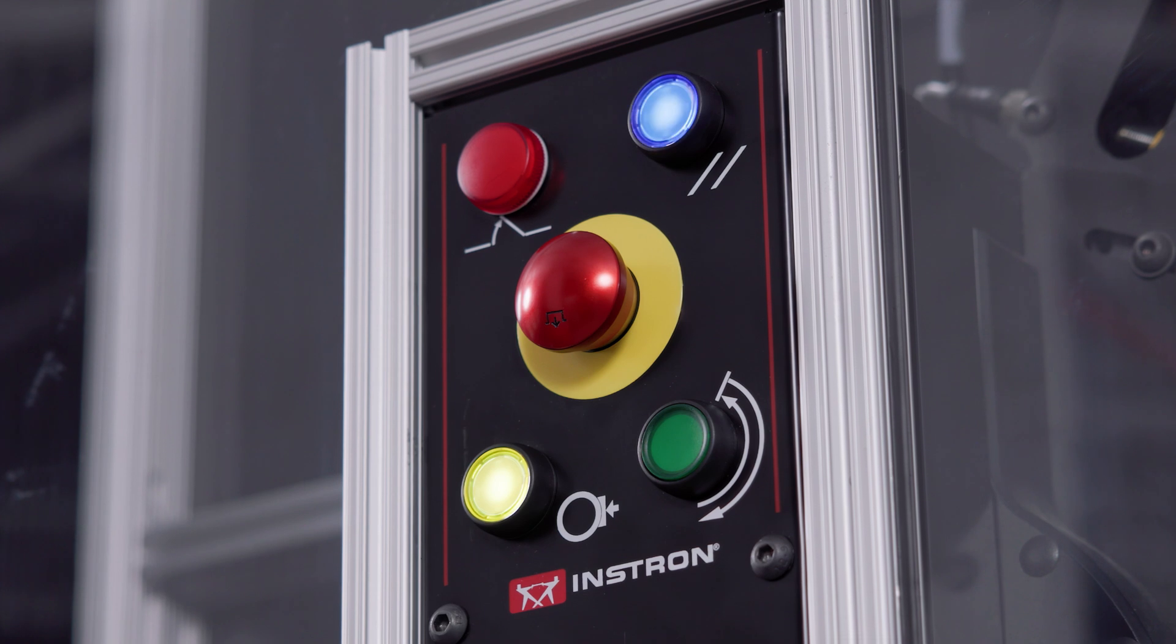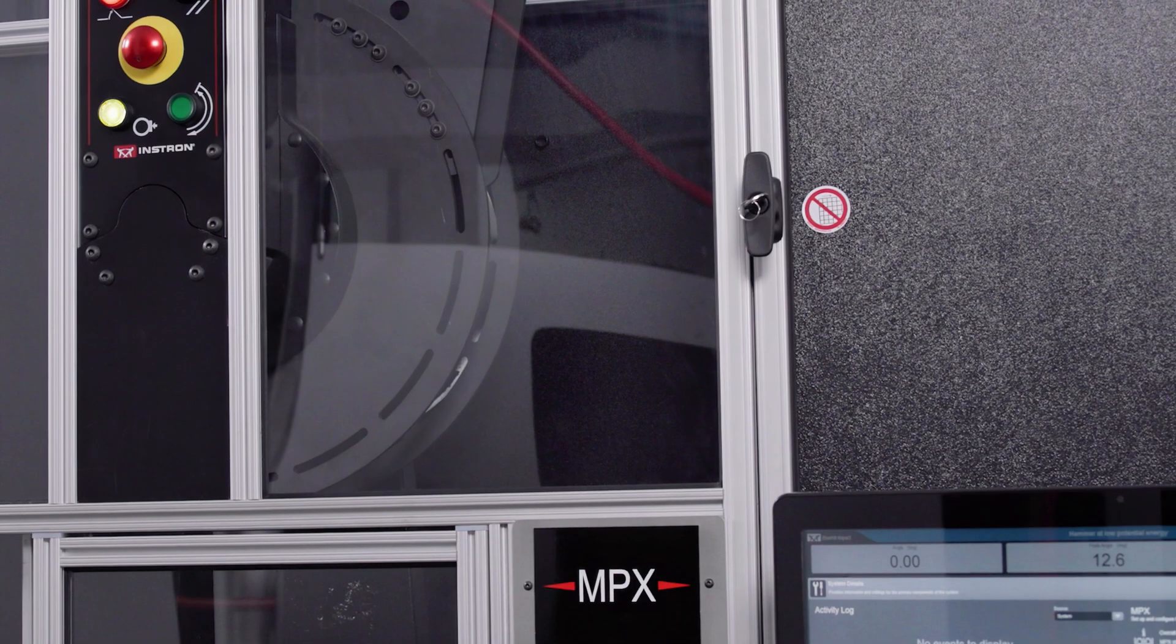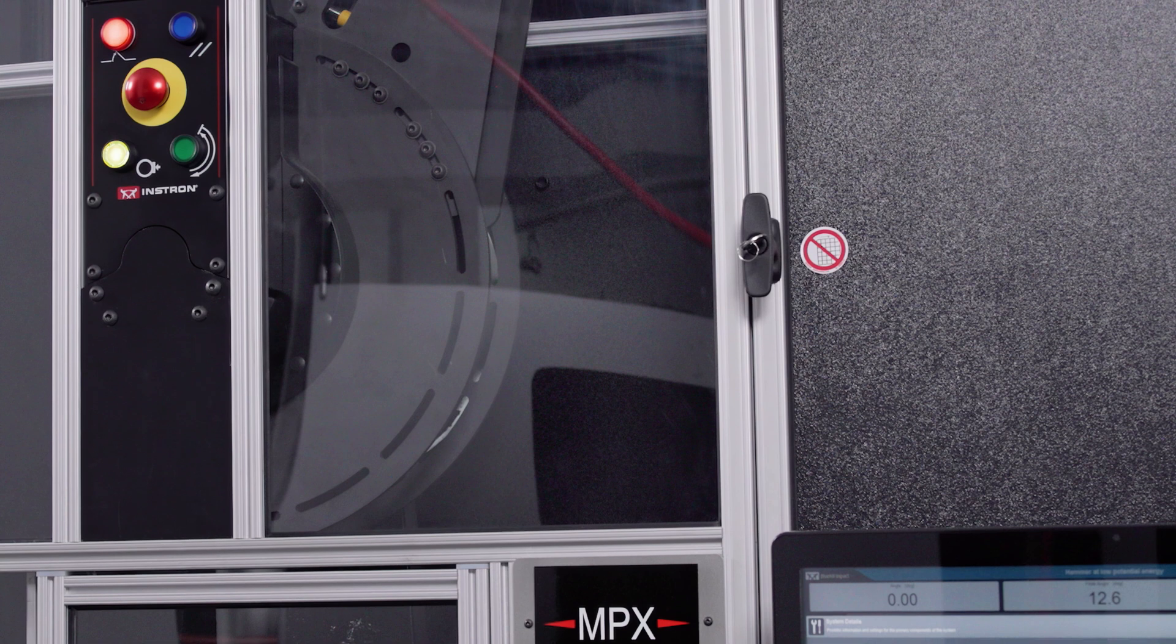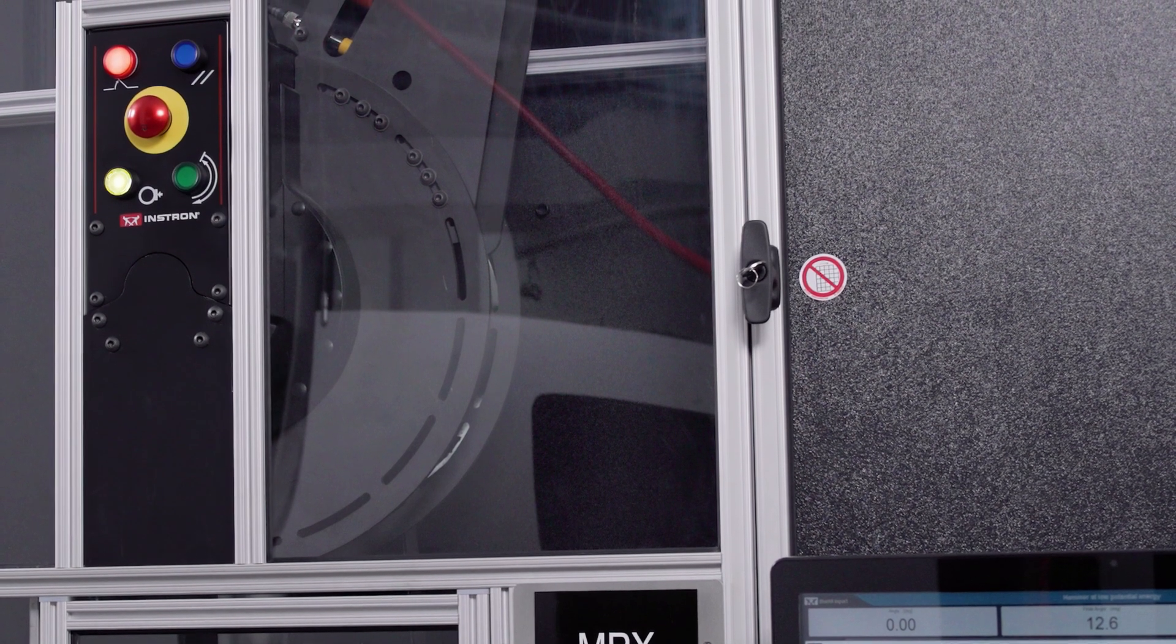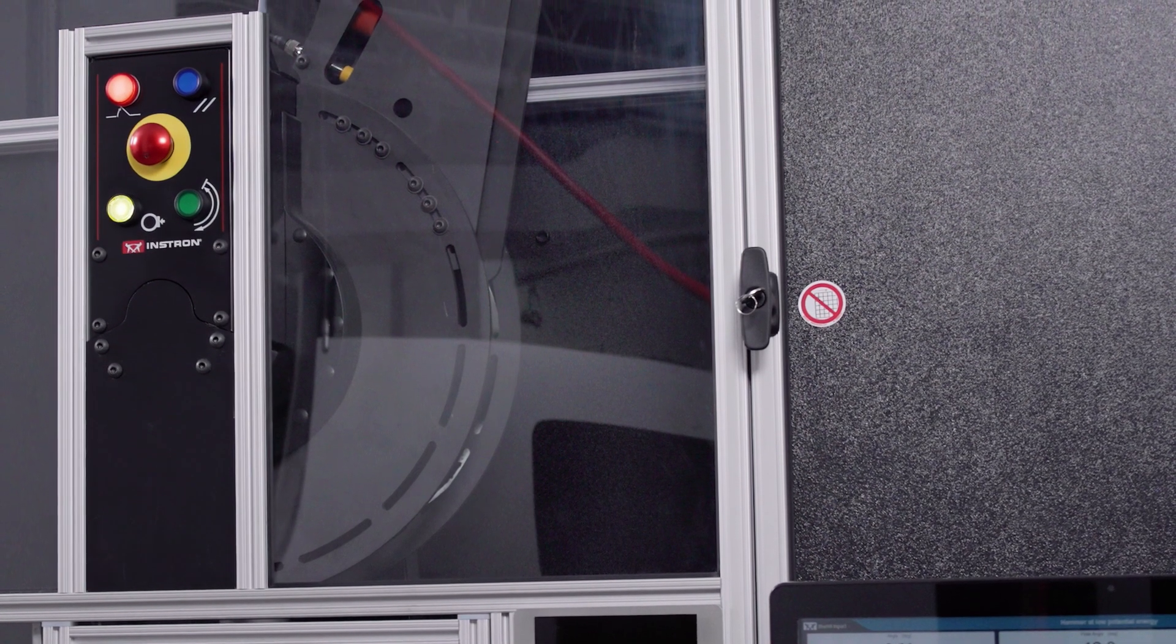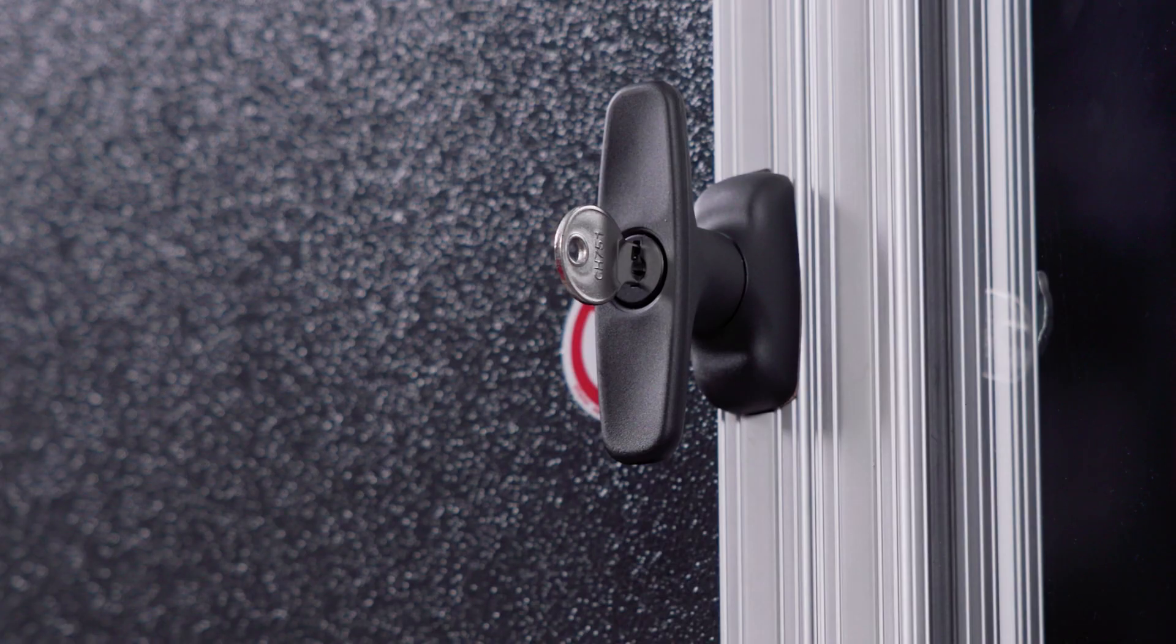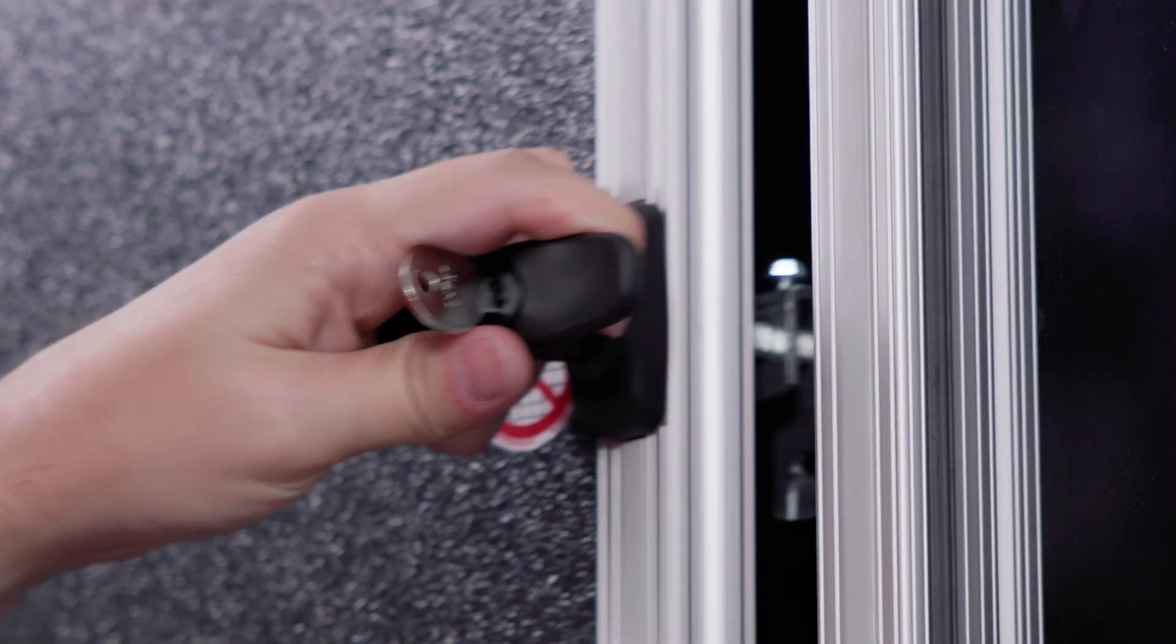With the hammer at zero energy and our e-stop activated, the interlock will disengage, allowing you to open both side access points. If you have doors like this, your next step will be to unlock the doors and twist the handle, or in the case of fixed guards, you would need to unbolt the panel to open it.